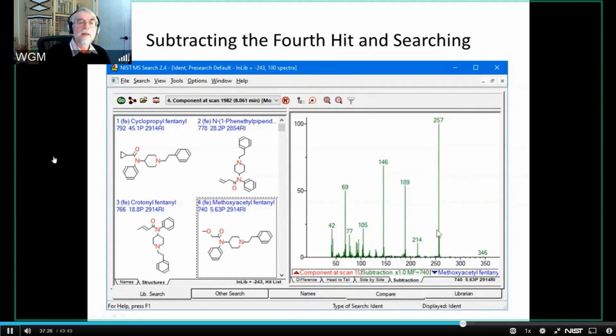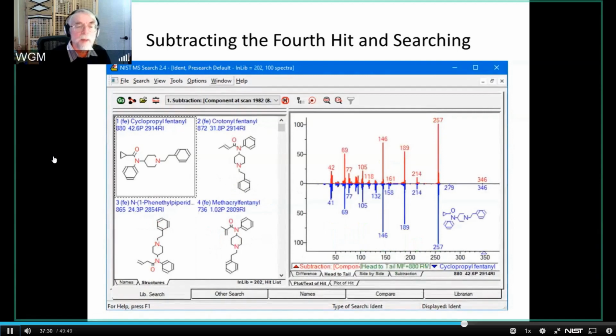And once again, I can search this spectrum. And when I search this spectrum, I get again the cyclopropylfentanyl, but we get it with a much higher match factor. And we still get the crotonylfentanyl and this other fentanyl, and we get the fourth isomer. So these are all of the four possible isomers of this fentanyl with this C3 attachment to it. There are no other possibilities. And so we've basically exhausted these things.